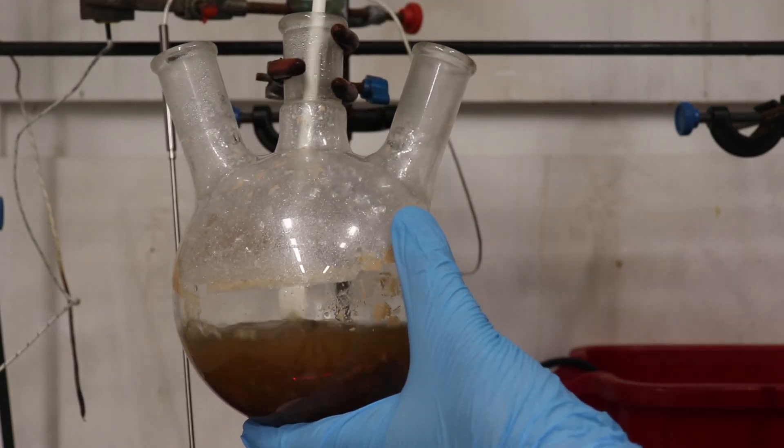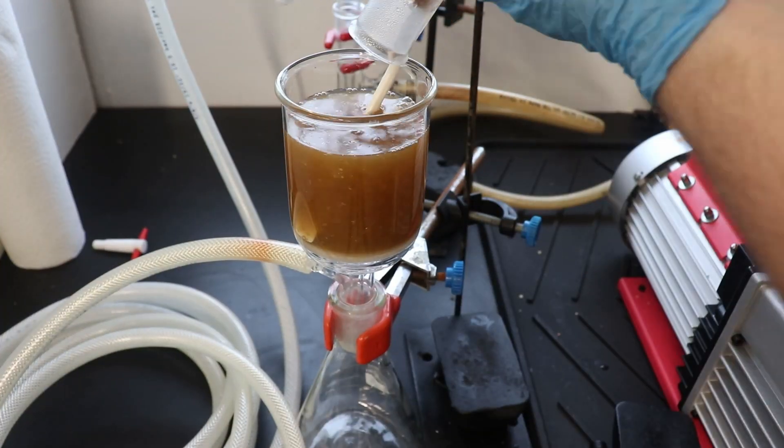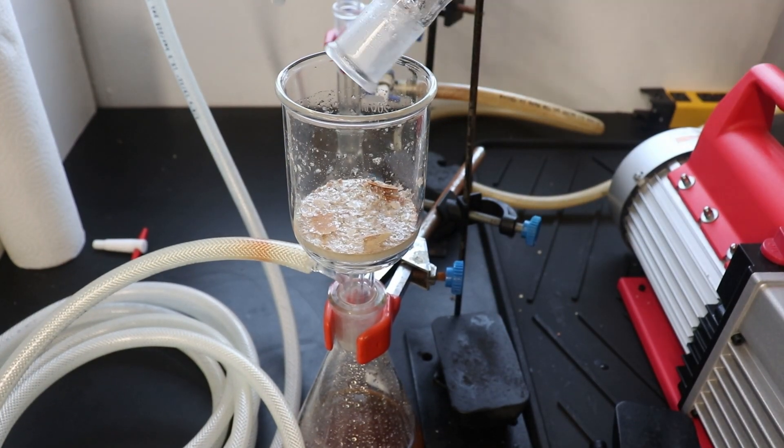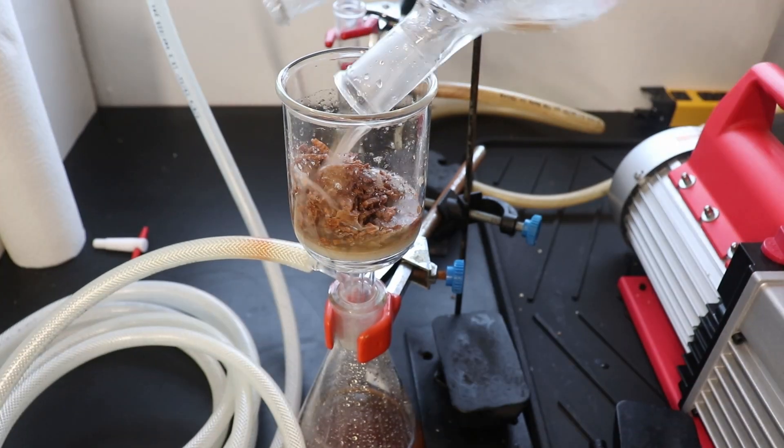The solid 2-methoxynaphthalene was then broken up, filtered, washed with a copious amount of water, and then allowed to dry in air.